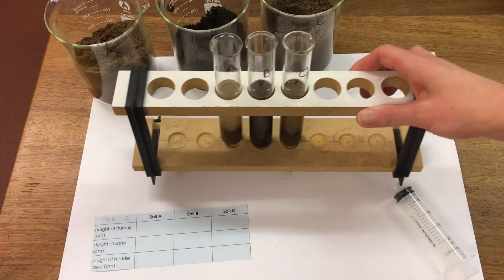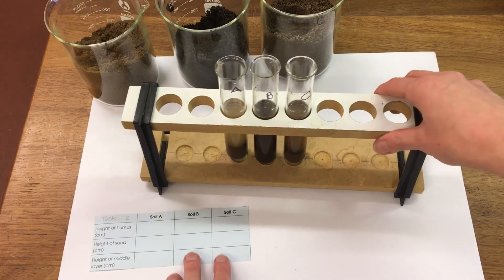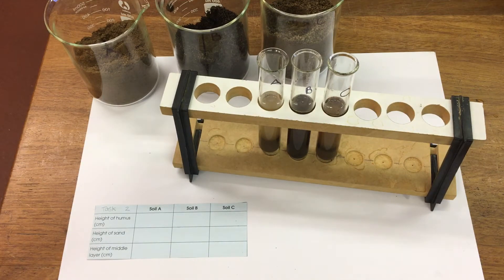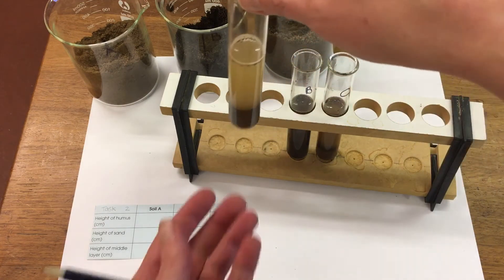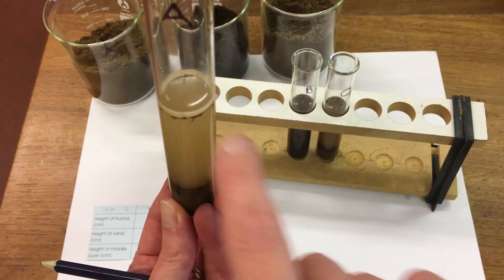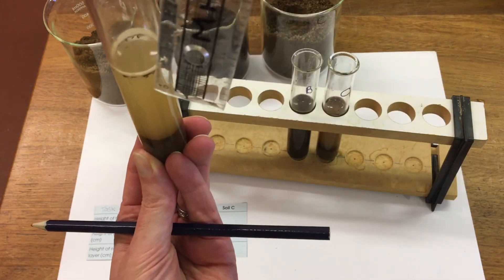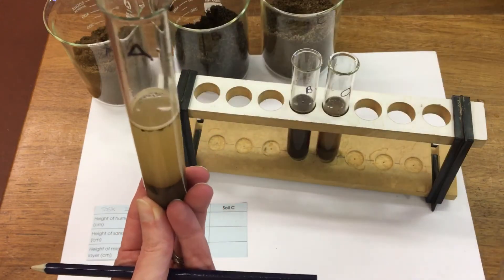These samples have been left for 20 minutes. We're going to look and see what the content is of each soil. For our first one, soil A, we're going to measure firstly the height of humus. That's the bit right at the top here - it's made up of plant vegetation. We've got about 0.1 cm.